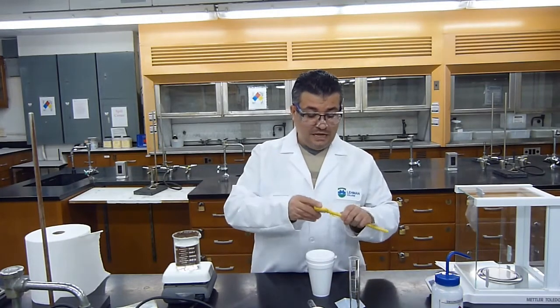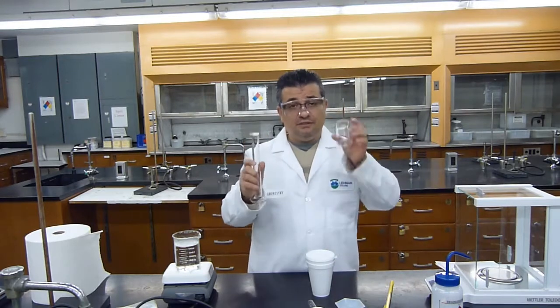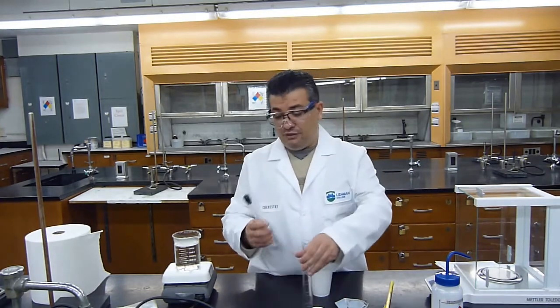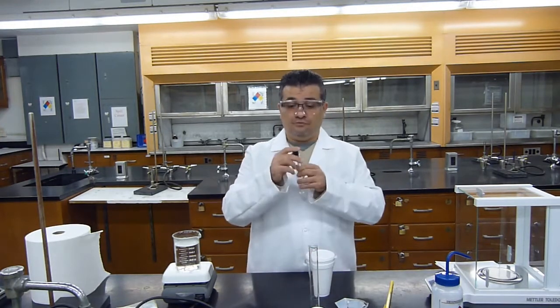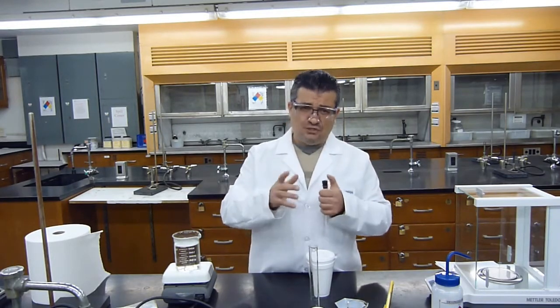Okay. I will also get a 50 ml graduated cylinder and a 100 ml beaker. I will get a test tube with a rubber stopper on it. If a rubber stopper is not available, that's okay.